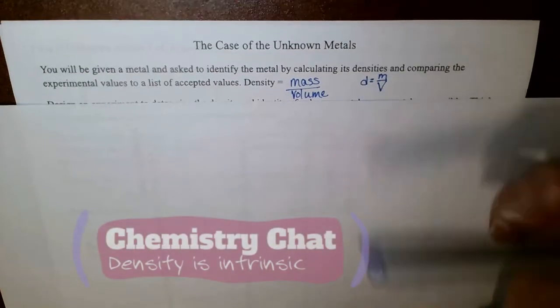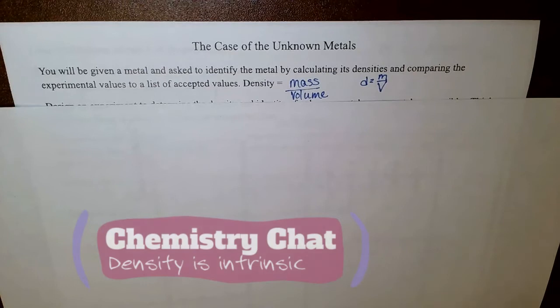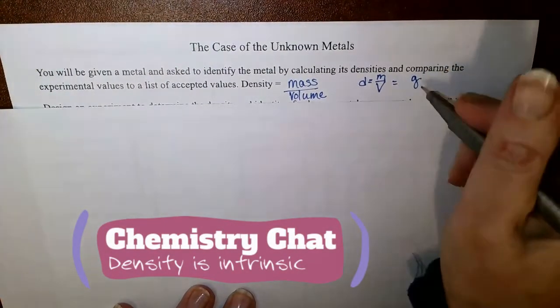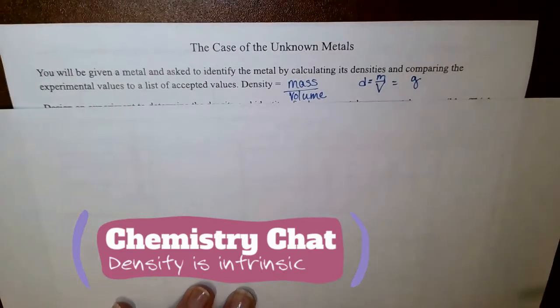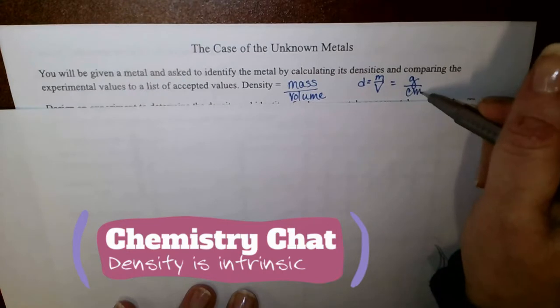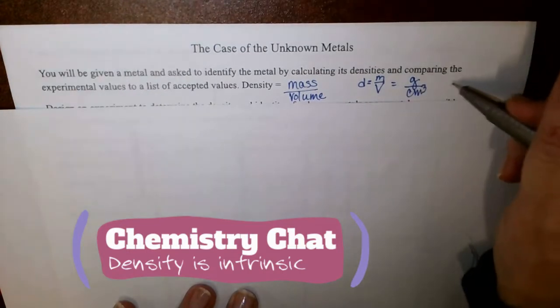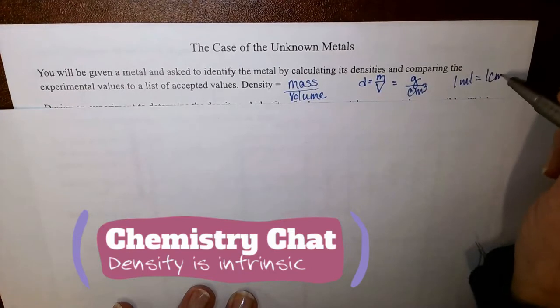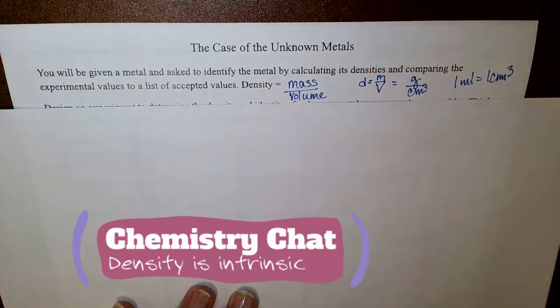The formula for density is mass divided by volume. The mass will be measured in grams. And the volume, if you look further down on the page, you'll notice that it is measured in centimeters cubed. Do keep in mind that 1 milliliter is equal to 1 centimeter cubed.